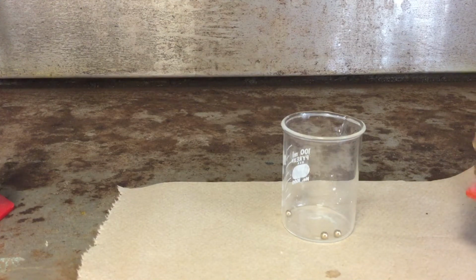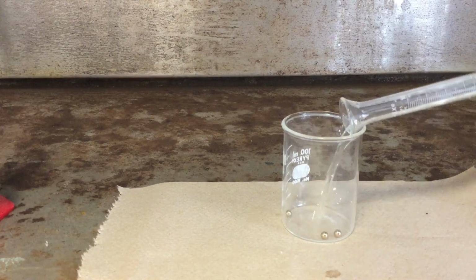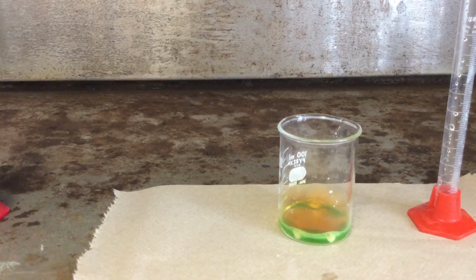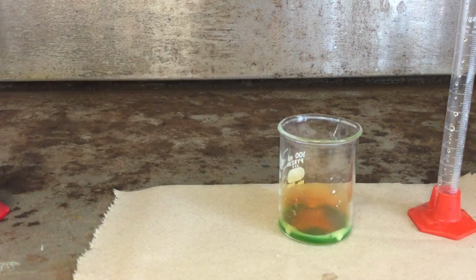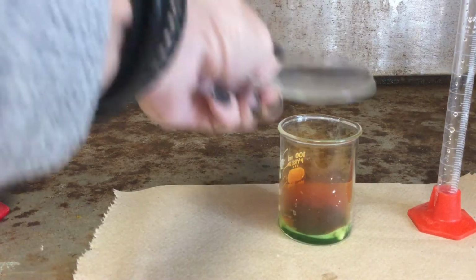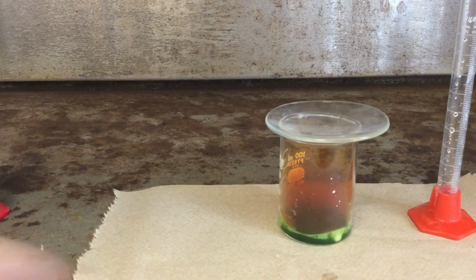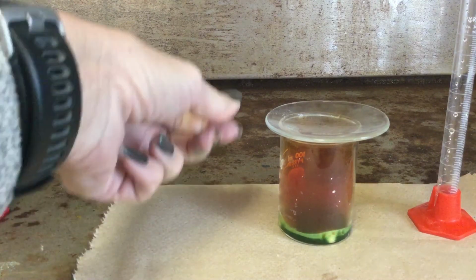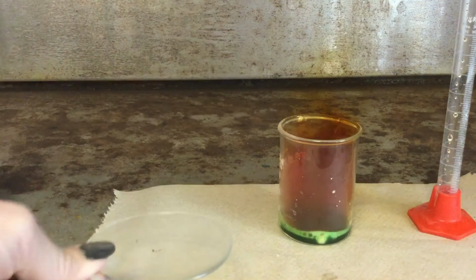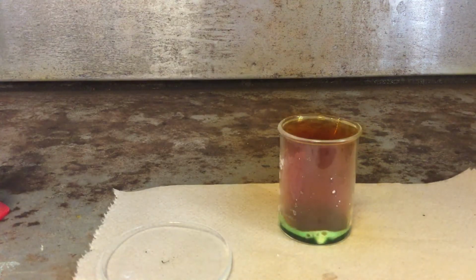The reason we have to do it in the fume hood, besides the fact that the nitric acid is concentrated, is it's going to make a brown poisonous gas. And you can already see the gas forming. All that bubbling is showing a gas. I'll even cover it so it kind of traps it. But look, all that brown stuff, that is nitrogen dioxide, very poisonous, not good. So that's why we need to do this in the fume hood, because we don't want to be breathing that. I'll let that go.